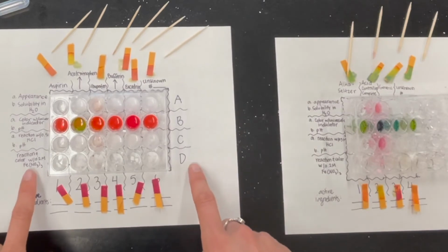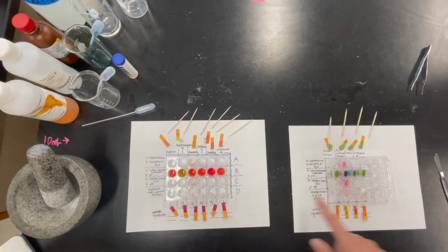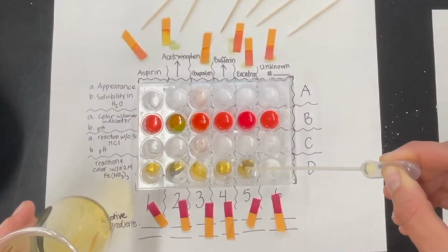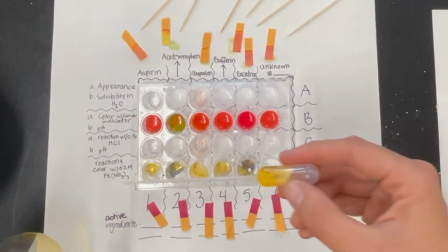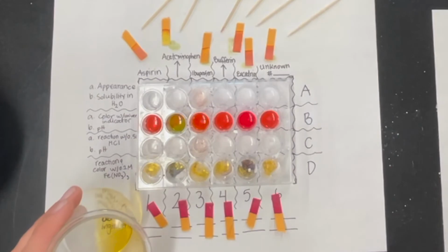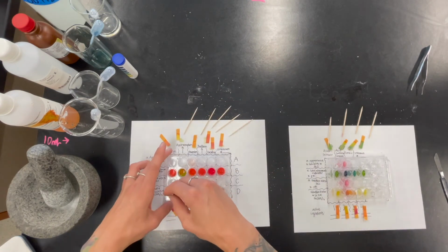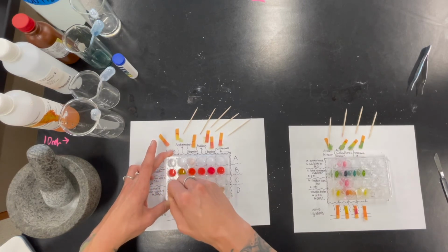Okay, now let's go ahead and do our last one, reaction and color with our iron nitrate solution. We're going to put that in here. Okay, we're going to do 10 drops in each of these wells. Ooh, we got some color change happening over here. That's what we want to pay attention to, the reaction and the color change. Okay, so we can see there's some stuff going on here, but let's go ahead and give it a mix. I'm going to use the other side here so that my hydrochloric acid doesn't potentially have a reaction.